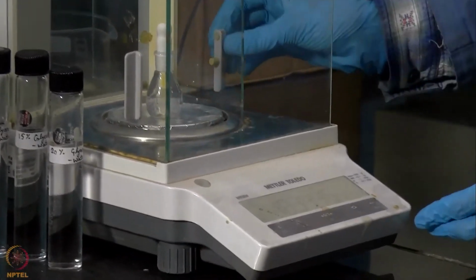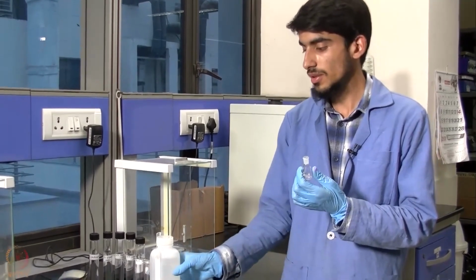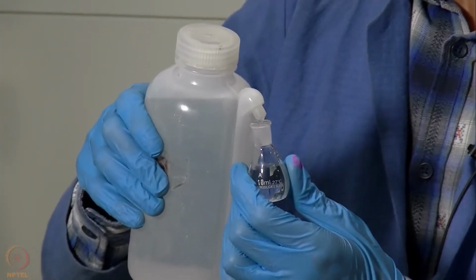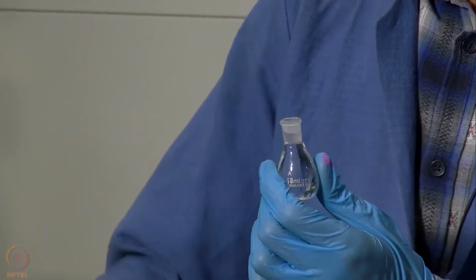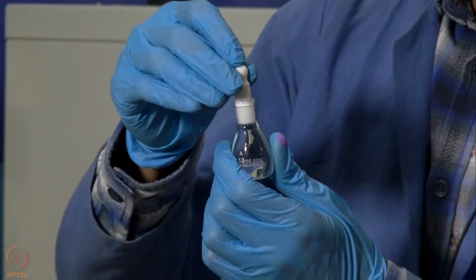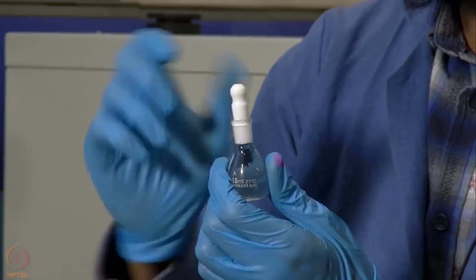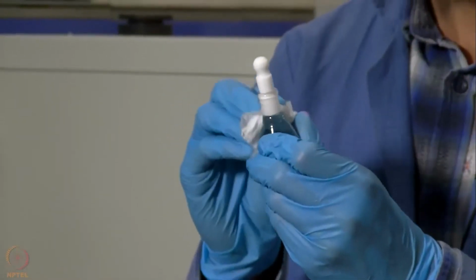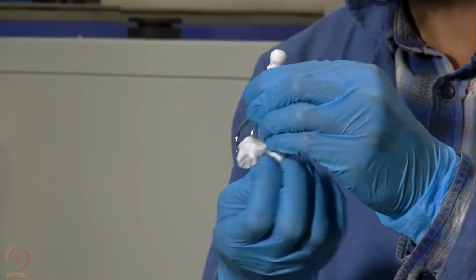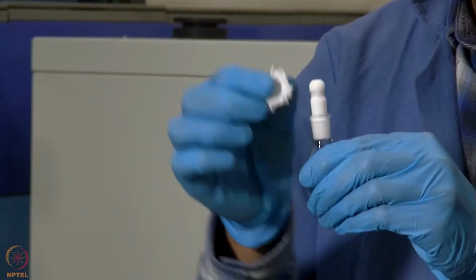Now what we need to do is we have to fill this specific gravity bottle with water. And we will then close the lid of this specific gravity bottle. So, water which is in excess from 10 ml will be out from the bottle, and we will have to wipe this bottle. So, we are just wiping the excess water which we had. This needs to be done properly so that we do not get the weight of any excess water present.